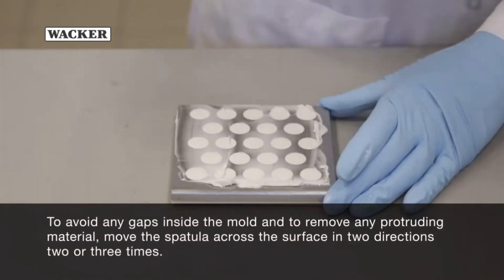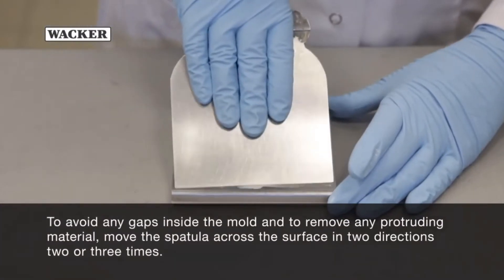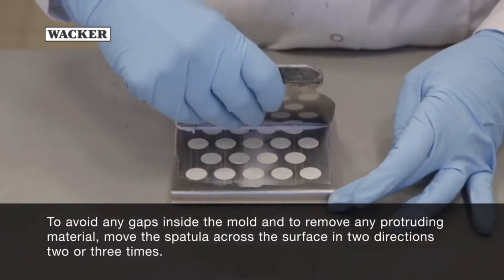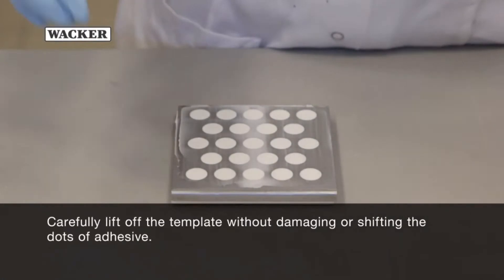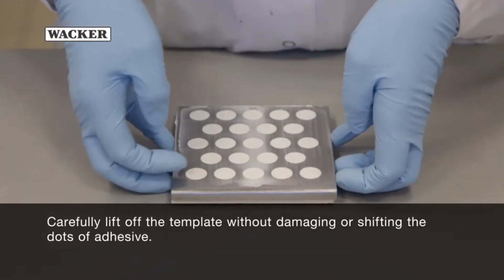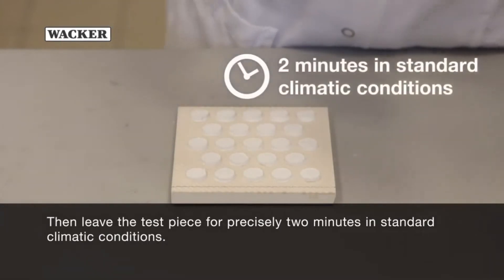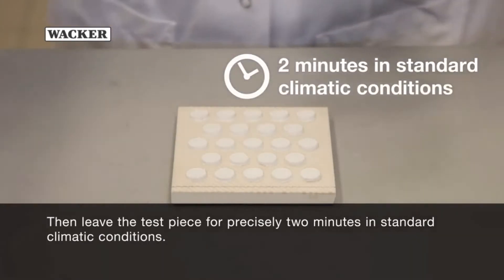To avoid any gaps inside the mold and to remove any protruding material, move the spatula across the surface in two directions two or three times. Carefully lift off the template without damaging or shifting the dots of adhesive. Then leave the test piece for precisely two minutes in standard climatic conditions.